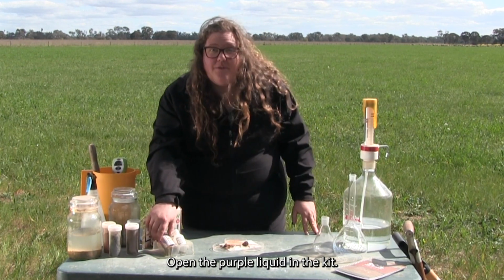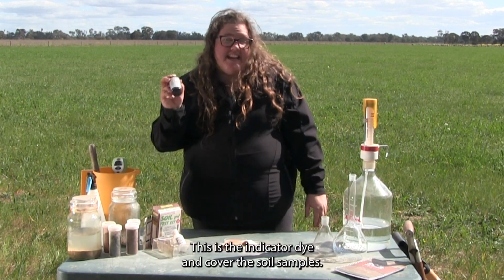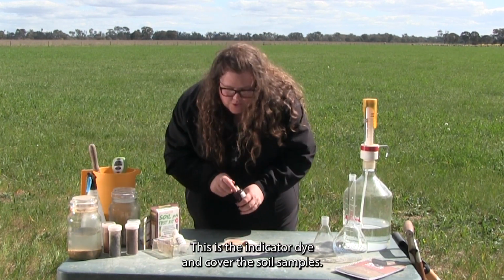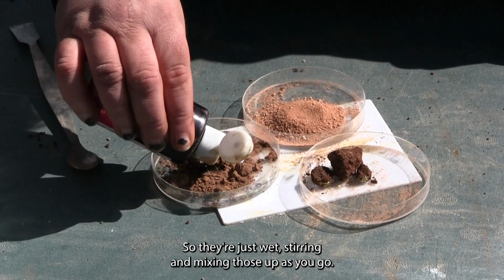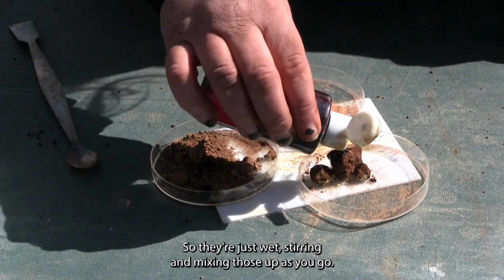Open the purple liquid in the kit. This is the indicator dye, and cover the soil samples so they're just wet, stirring and mixing those up as you go.